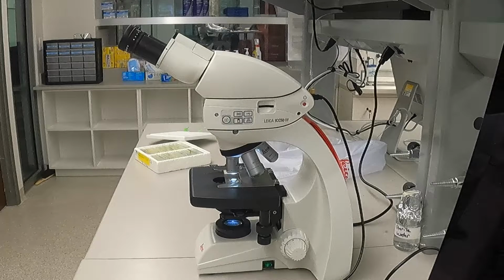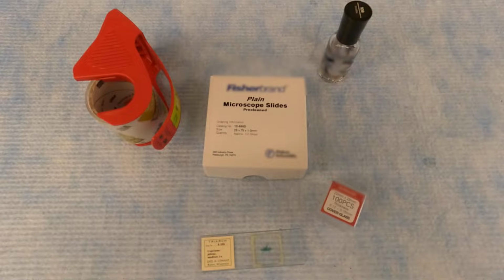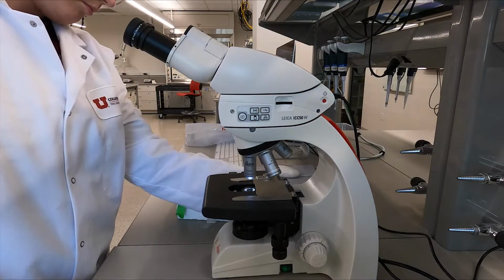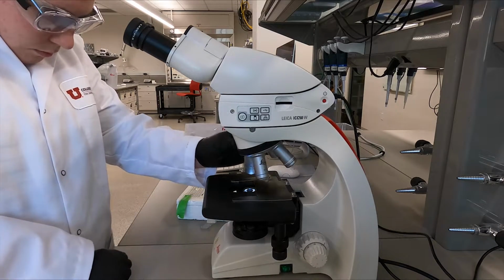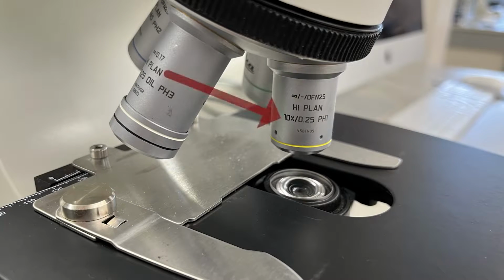Now that we know the basic components, let's walk through how a microscope can be used to view a sample. Sample preparation will vary by course and experiment, so we will not cover that in this video. Follow any instructions provided by your TA or instructor. Once you have a sample prepared, power on your microscope. Then check that the stage is at the lowest position and that the revolving nosepiece is rotated until the lowest powered objective has clicked into position. For this particular model, the lowest powered objective lens is the 10x objective.